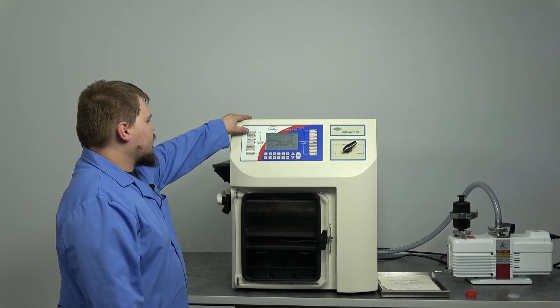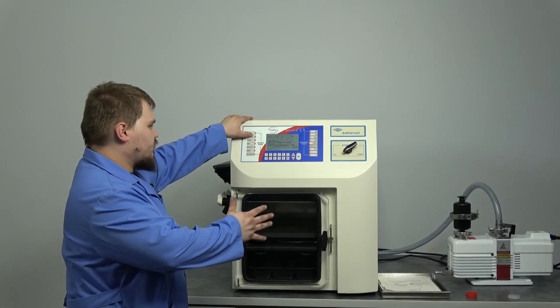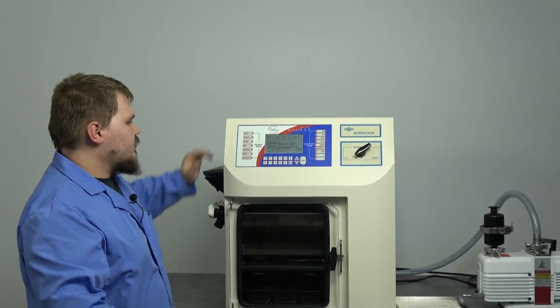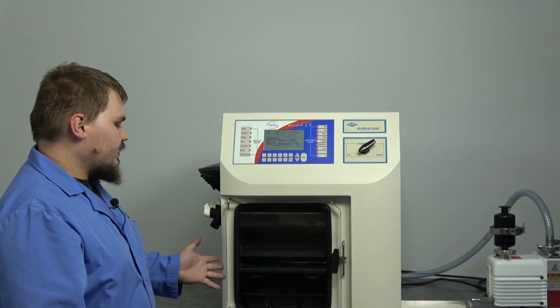From there, all we have to do is test the system. Since everything else is hooked up, hit the condenser button, and that's going to start the condenser.